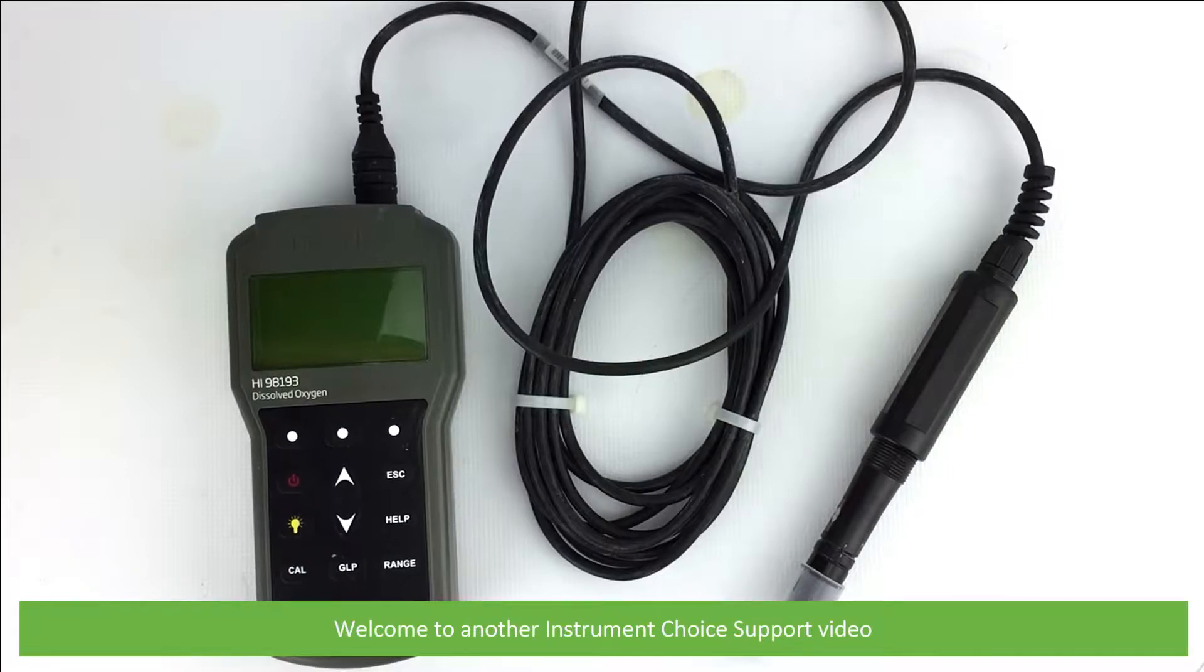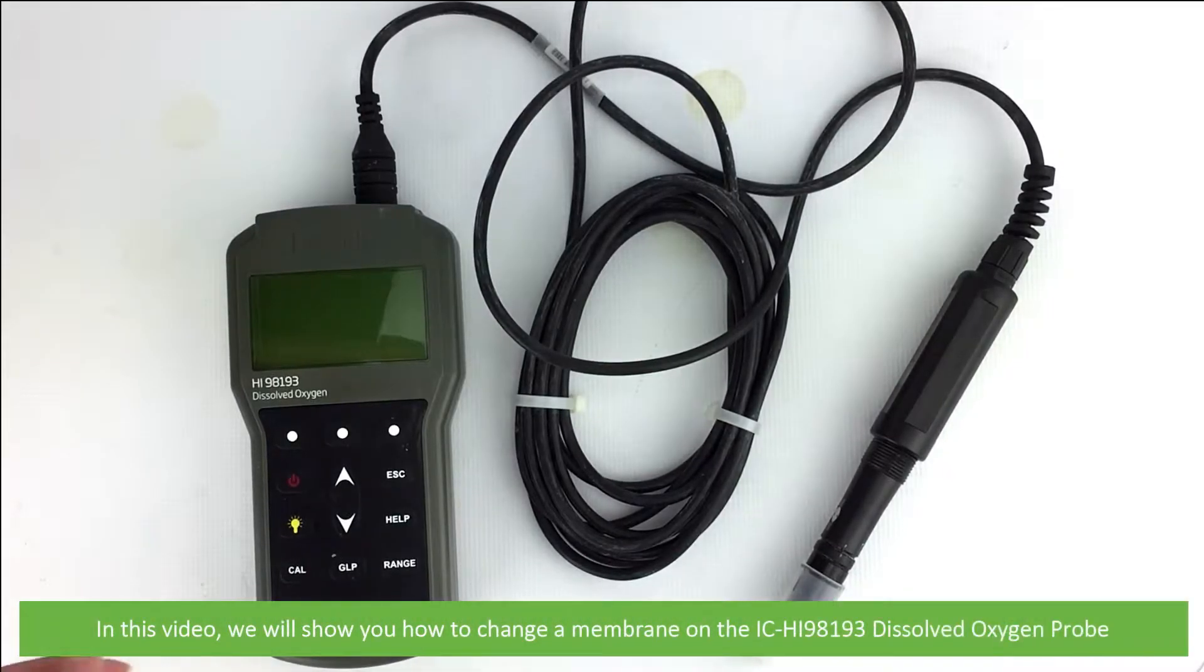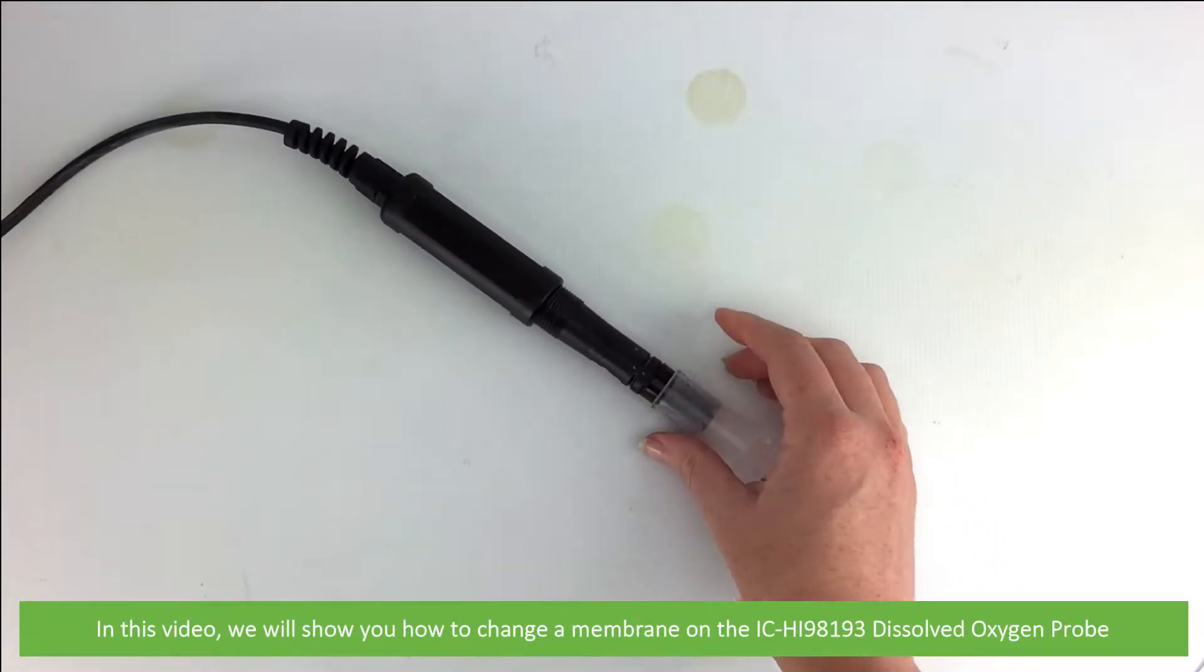Hi and welcome to another Instrument Choice support video. In this video we'll show you how to change a membrane on the IC HI-98193 dissolved oxygen probe.